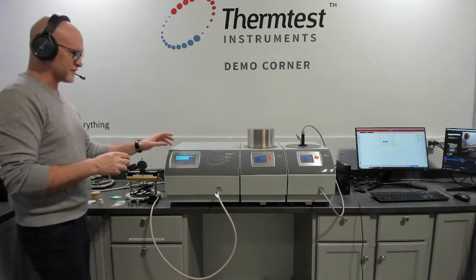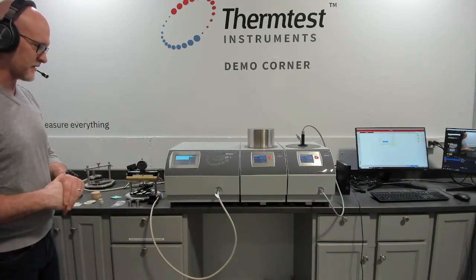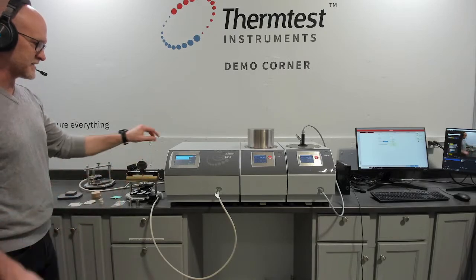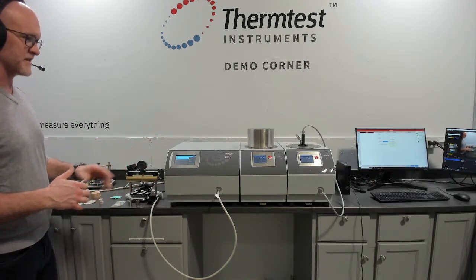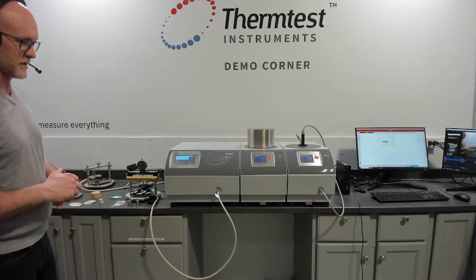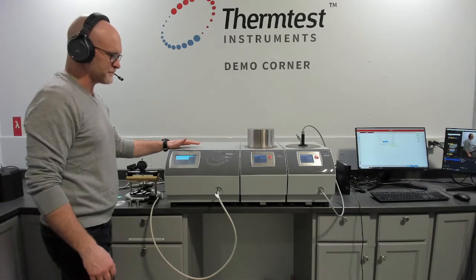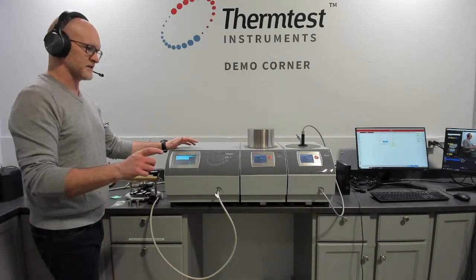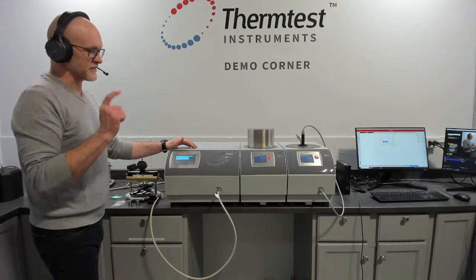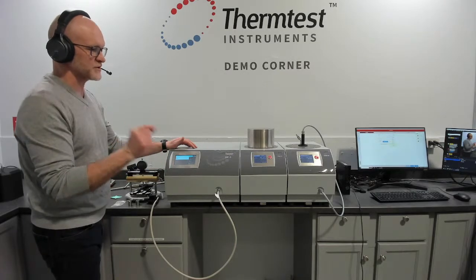Some of the other things that make the MP-1 unique in the market is when you're measuring high conductivity, the MP-1 has a conductivity range of 0.005 up to 2000 watts per meter Kelvin. What facilitates that is its ability to record small test times in our data collection, our frequency of data collection. So the shortest test time available in MP-1 is 0.25 seconds, where we're actually collecting 600 data points. So with that many data points, we can cut 0.25 seconds down to a much shorter window.